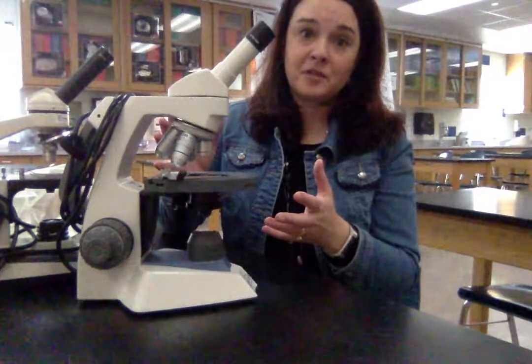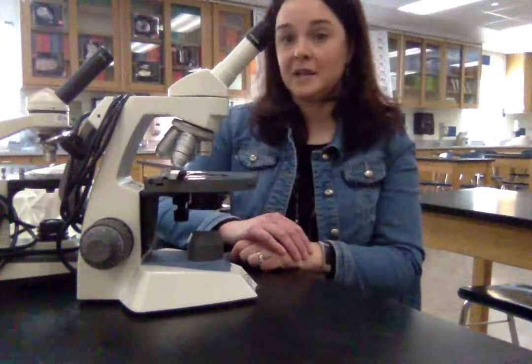Our compound light microscope has many important parts, and it's important that you're able to label a diagram of a microscope. If you're in class, you can get a paper copy of the notes — those are very helpful. There are also online activities where you can match the microscope part to the microscope diagram, but practice makes perfect. So this is our compound light microscope.